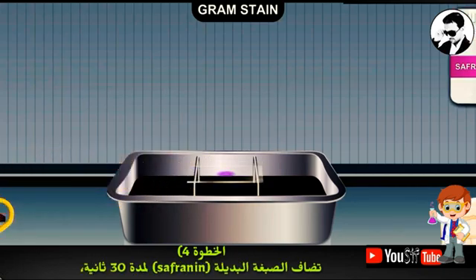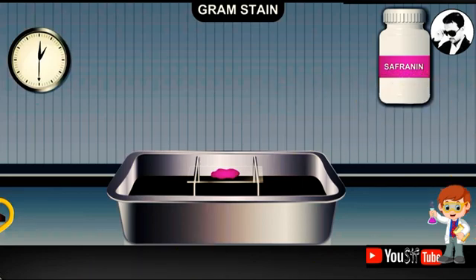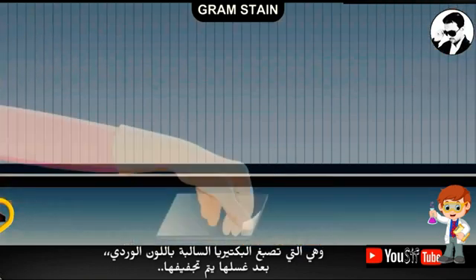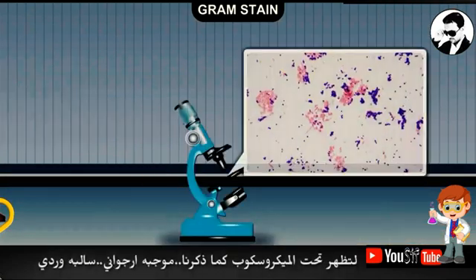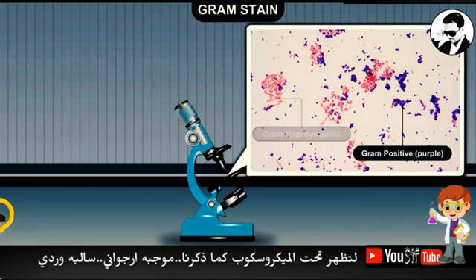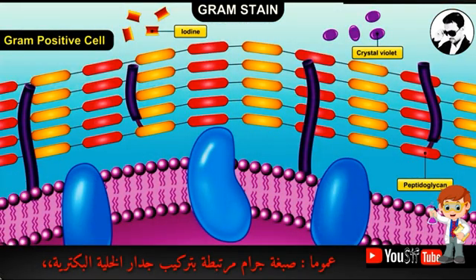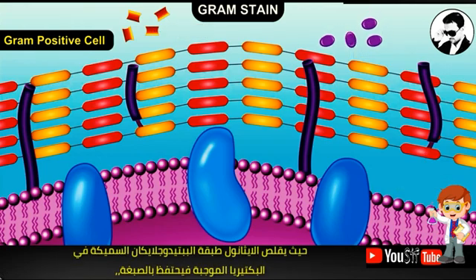Finally, the rinsed cells are covered with the counterstain safranin for 20 to 30 seconds, which stains the gram-negative bacteria pink. After rinsing with water, the slide is dried with filter paper. When viewed microscopically, the gram-positive bacteria are purple and the gram-negative bacteria are pink.